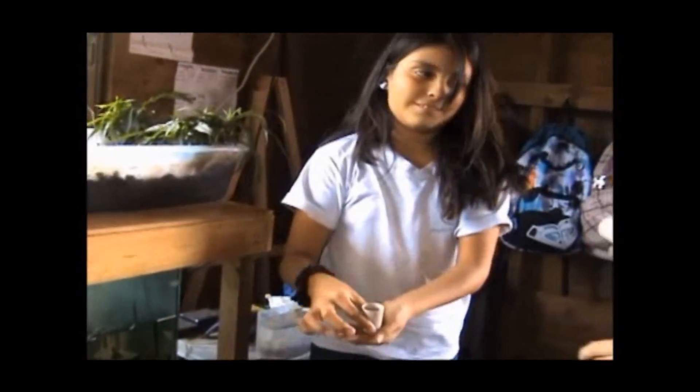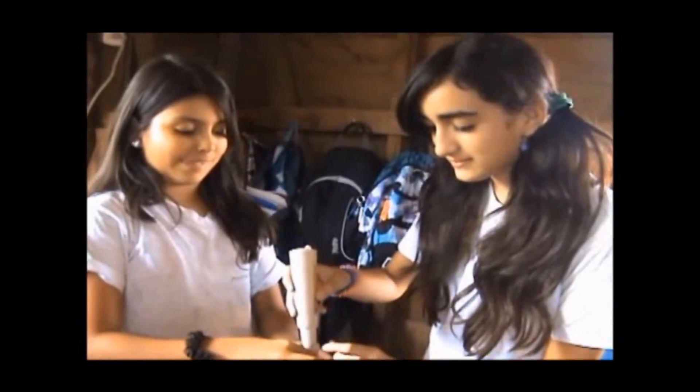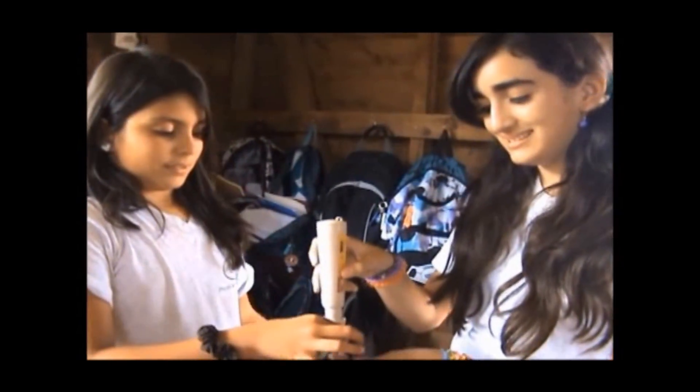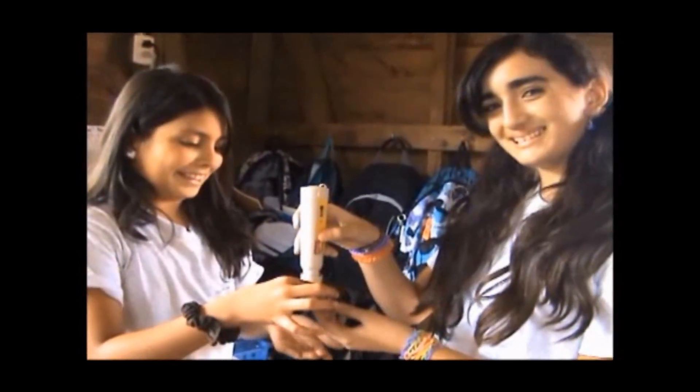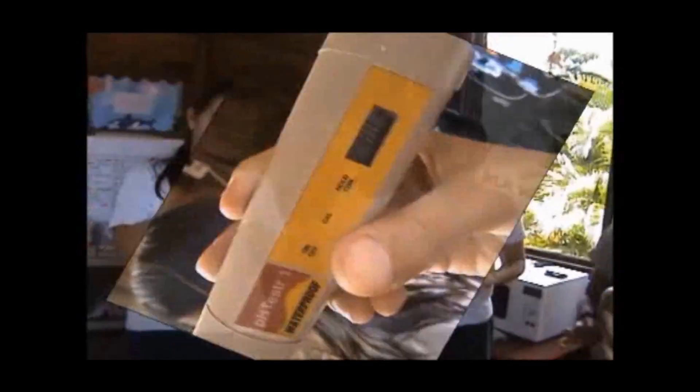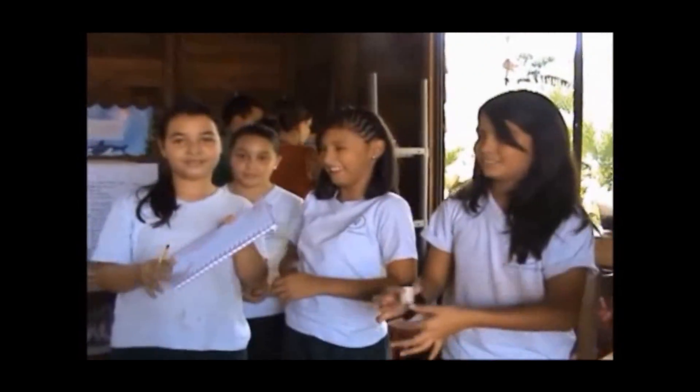The stabilized reading is the pH for the sample water. Now take the reading for sample B. Make sure the meter is off, rinse the electrode on the bottom, and write your reading in the data sheet.